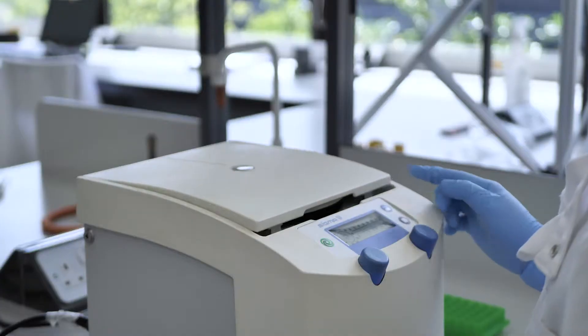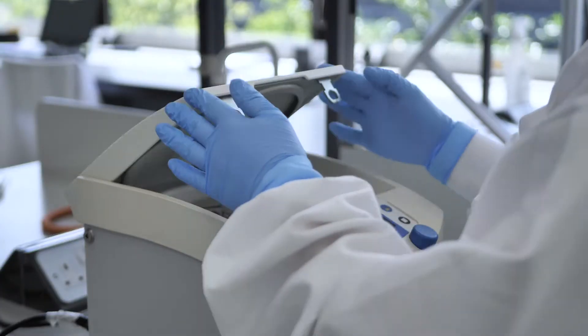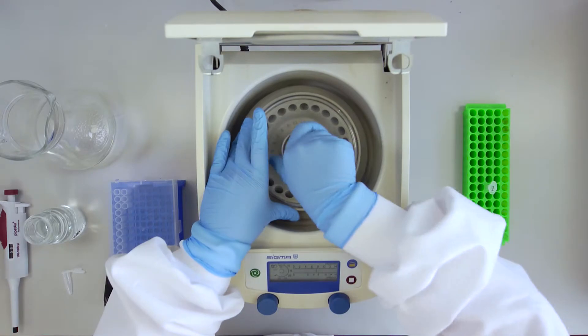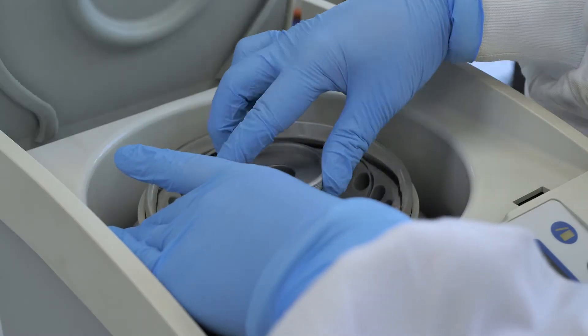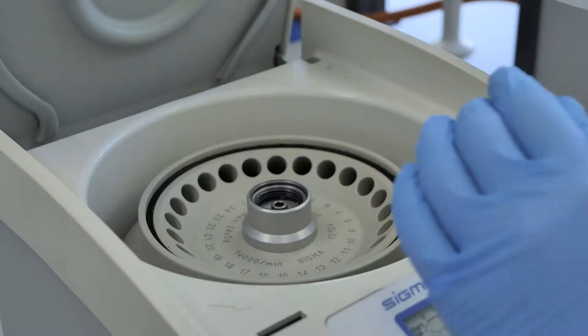Press the lid button to open the centrifuge and remove the internal cover. Check the rotor is clean, dry, and free of debris.